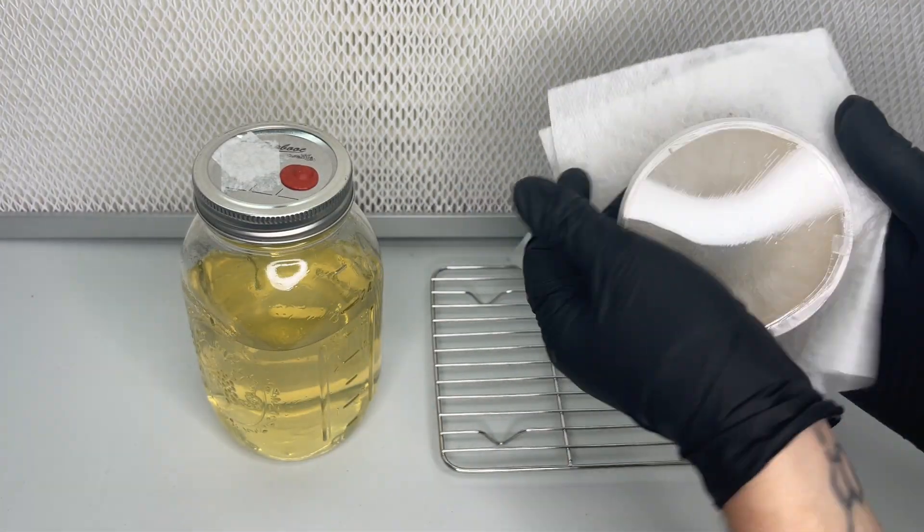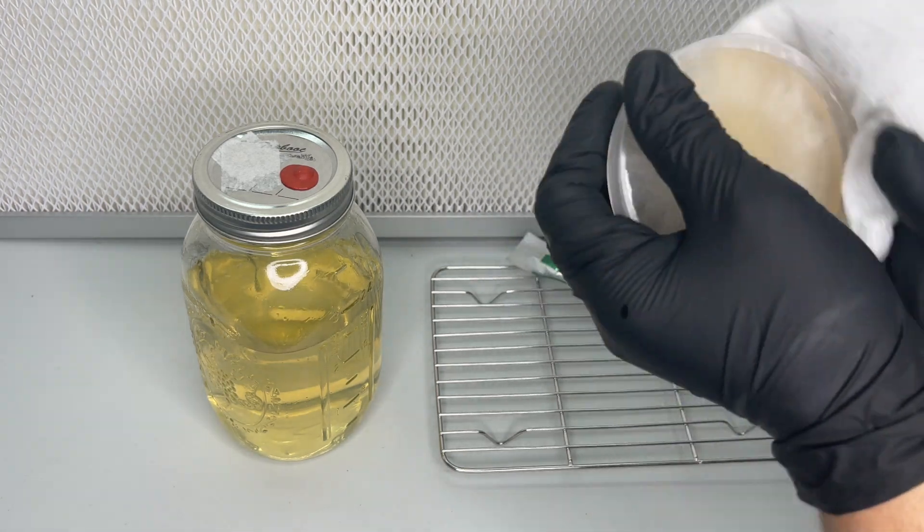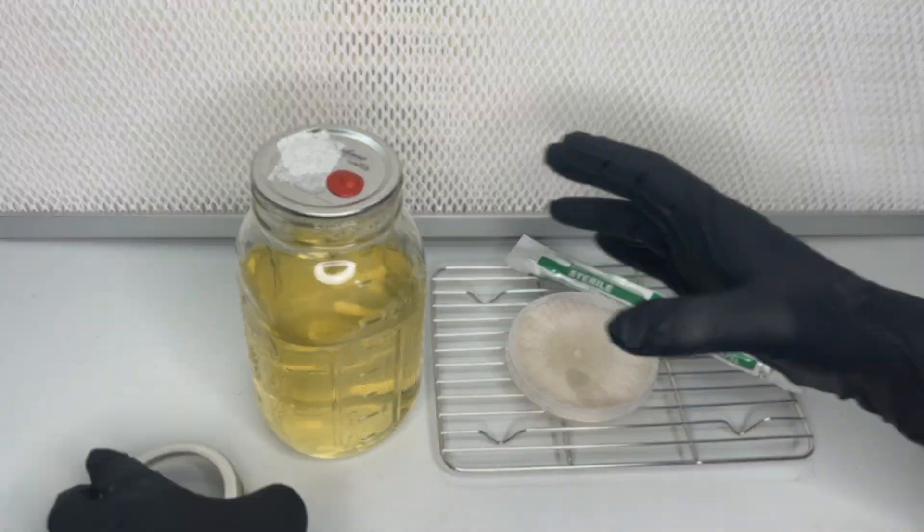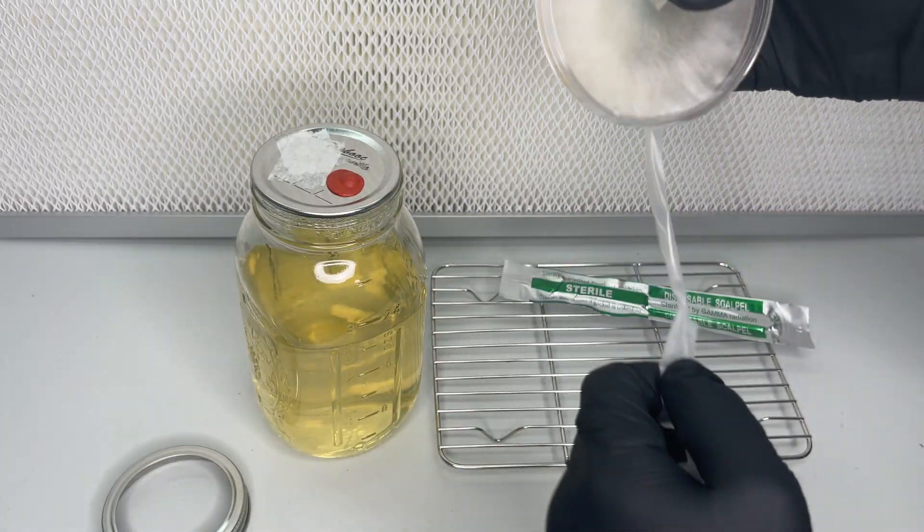And that's all there is to it. The mushroom culture has been cleaned and there's no more orange bacteria. From here you can transfer the mycelium to liquid culture for expansion or you can propagate it more on agar plates.